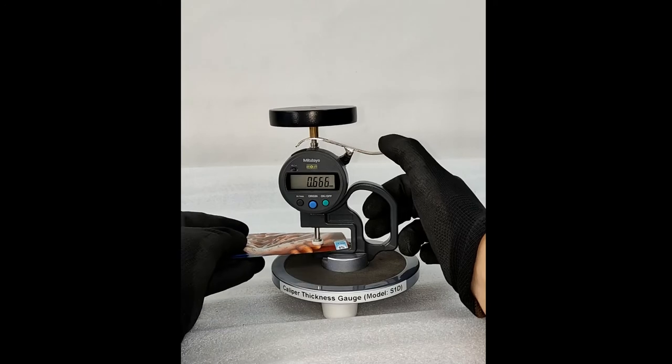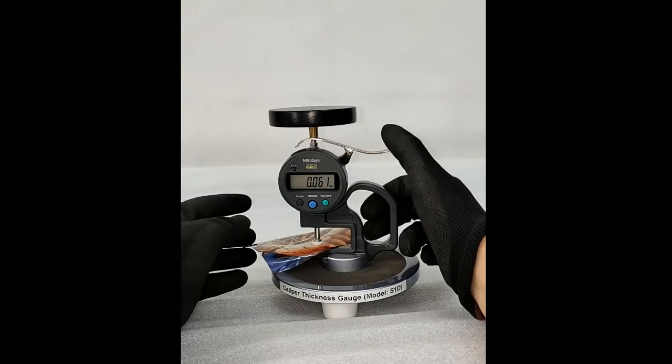Press the lever again and shift the sample. Repeat at multiple locations to get a better average.